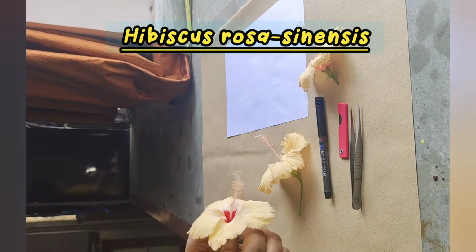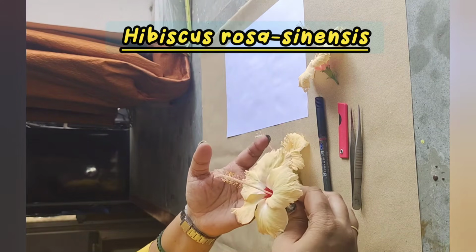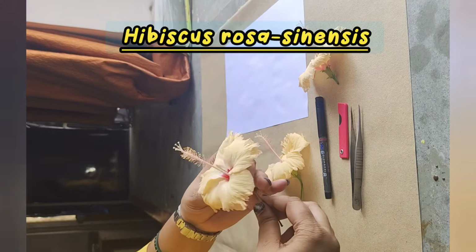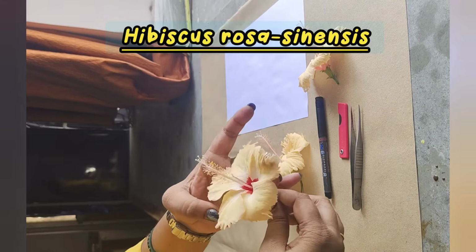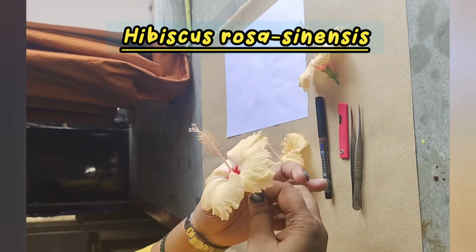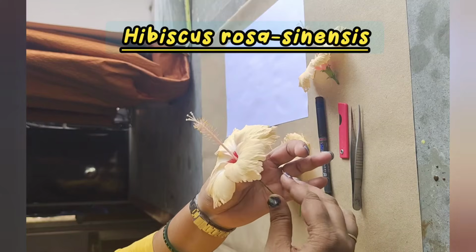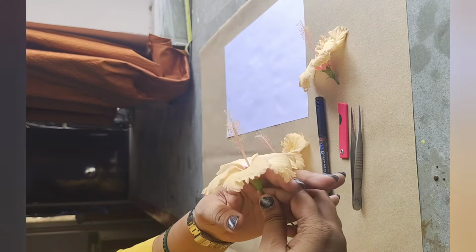One such example of a complete flower is the hibiscus plant, which we commonly know as the China rose flower. The biological name of this flower is Hibiscus rosa-sinensis, and it belongs to the family Malvaceae.